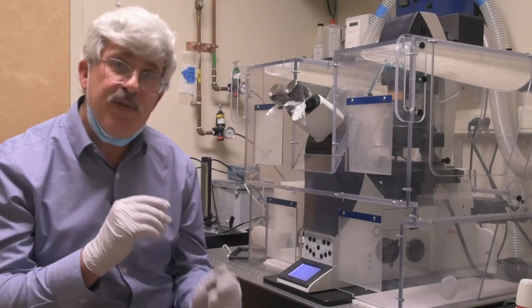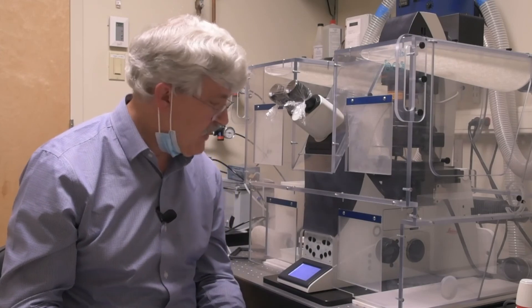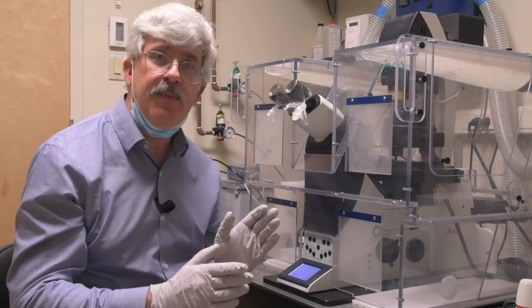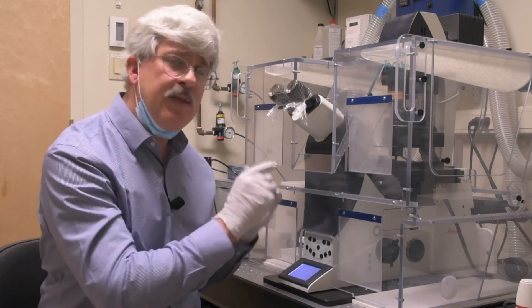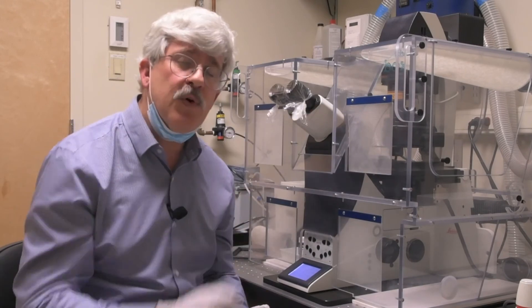These filter cubes are very broadband, and they let through a lot of overlapping wavelengths of light. Their only purpose is to help you find something and focus on it and make sure that it's there. Don't make the mistake of looking through here and trying to see if your experiment worked or not. That's what the confocal is for.